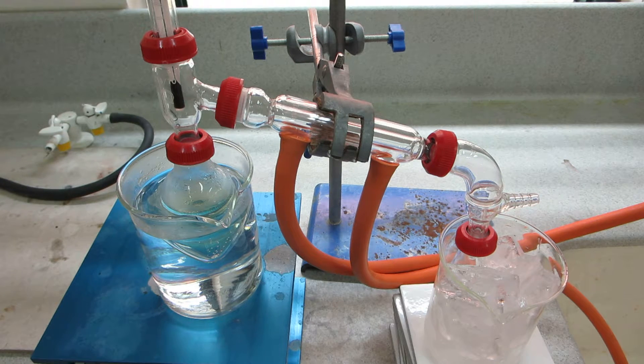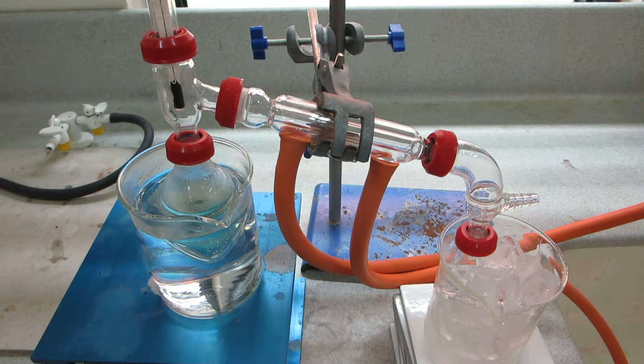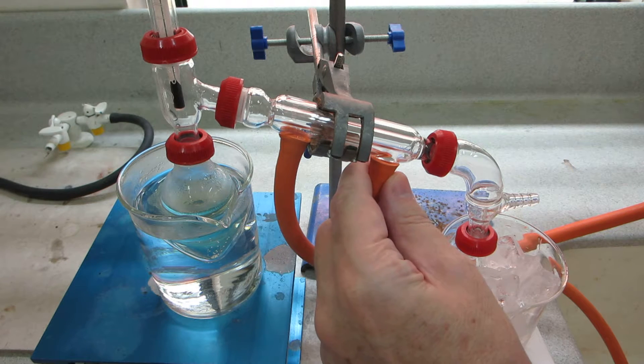There is something of a lag phase during this reaction, but once it gets going, it can be rather quick. Let's now turn the water on on the condenser.